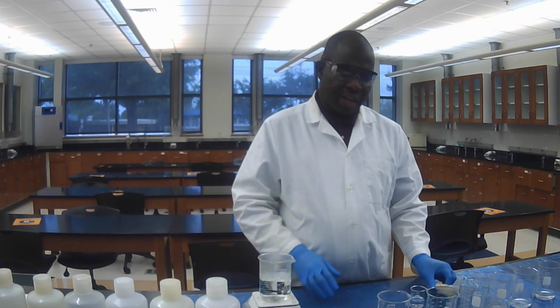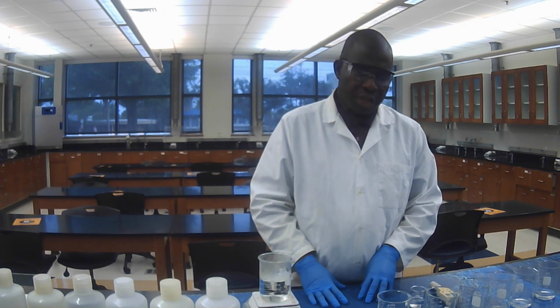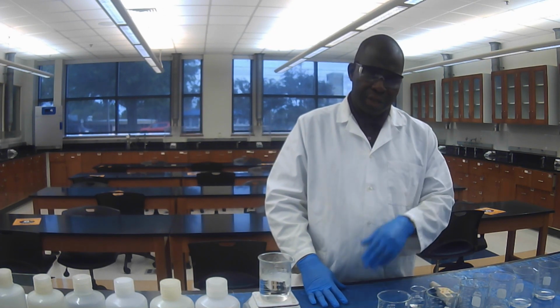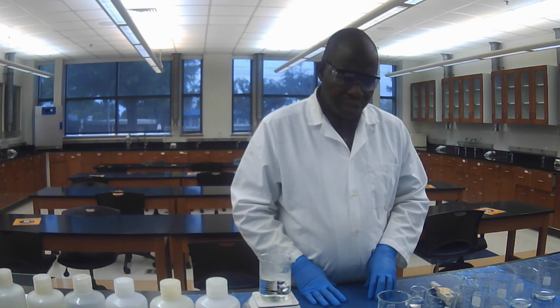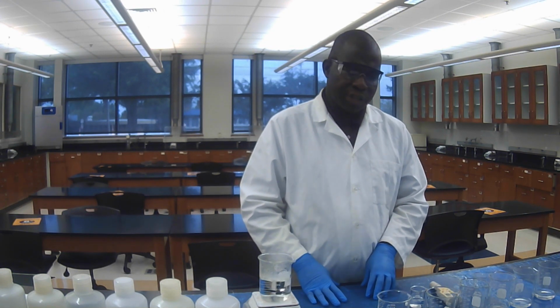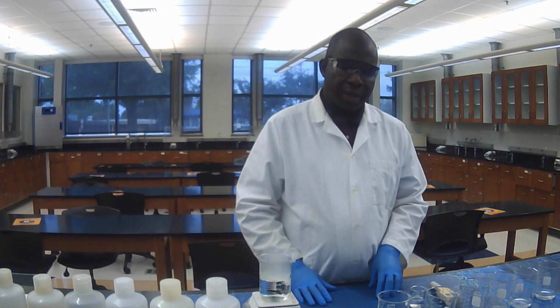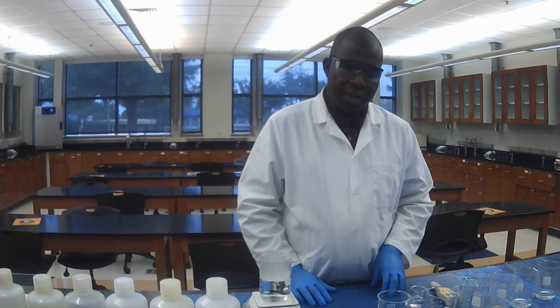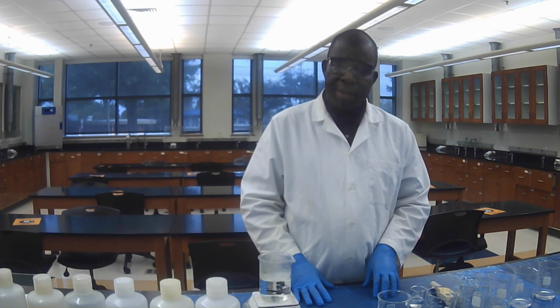Okay, after you do that, you move to the second step in this experiment. You are going to collect a 400 milliliter beaker and fill it with DI water to 200 milliliters.